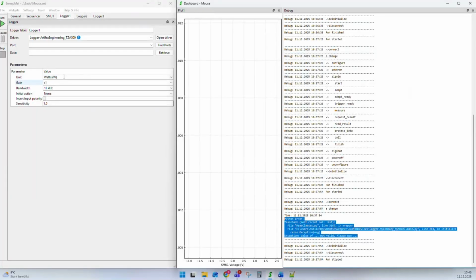This parameter box is available for some modules. For example, for these very generic modules like Logger. Logger is a module where you implement a driver that does not fit to the other instrument modules. That is a generic driver for getting data from an instrument, like a logger, let's say, like a temperature logger, a sensor, and so on.